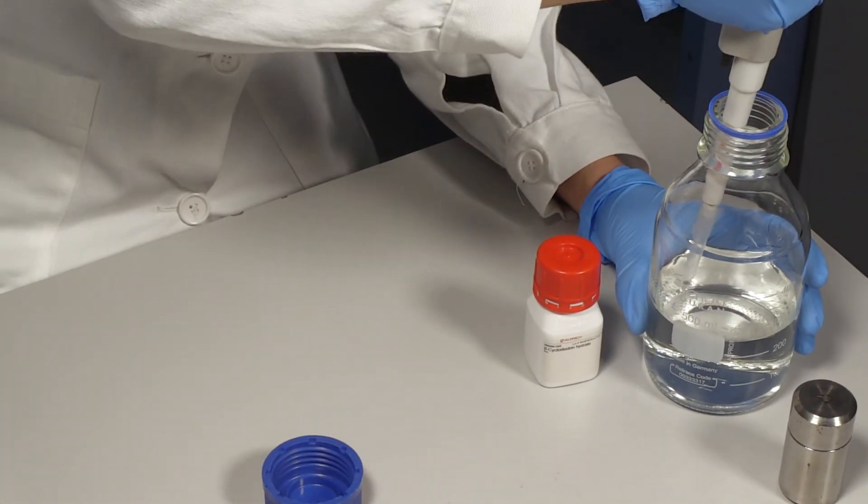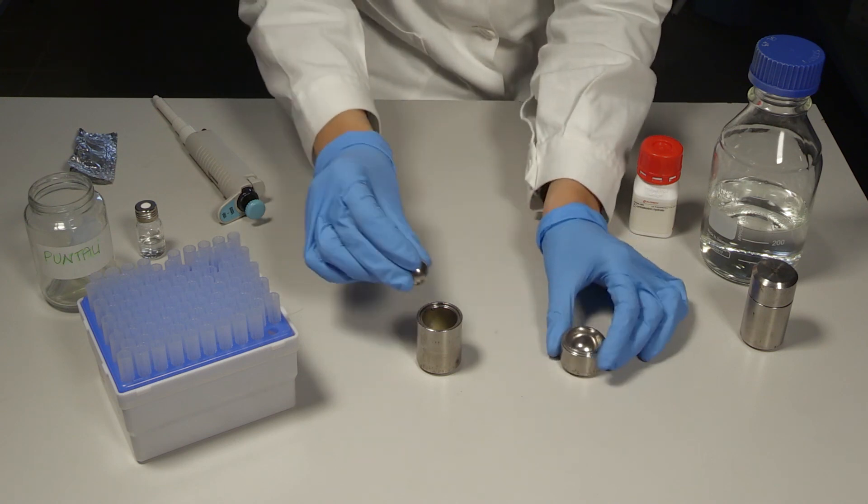After the addition of a water ethanol solution, a steel ball is placed into the jar.